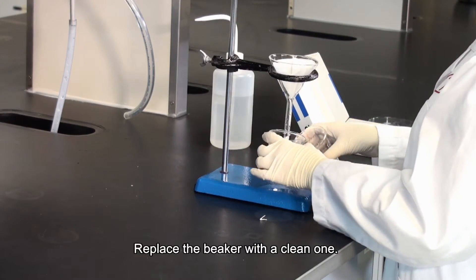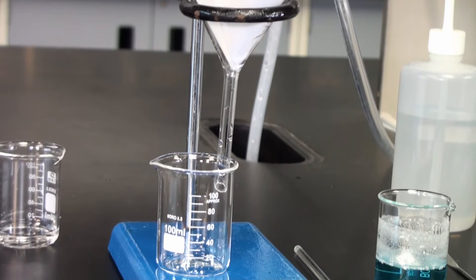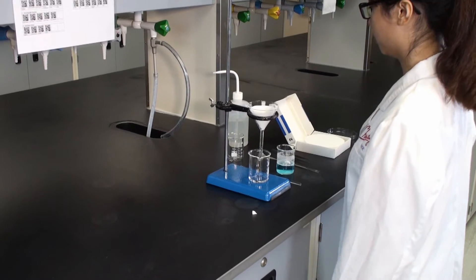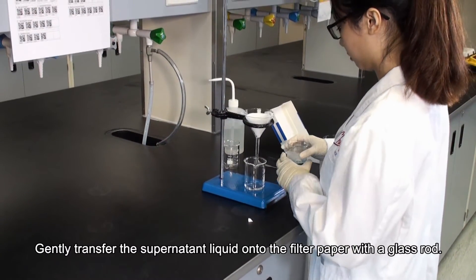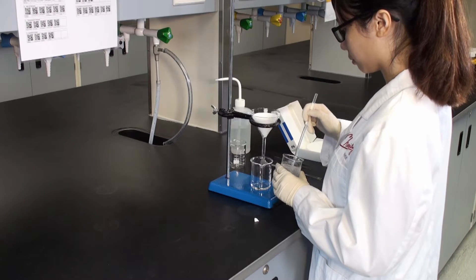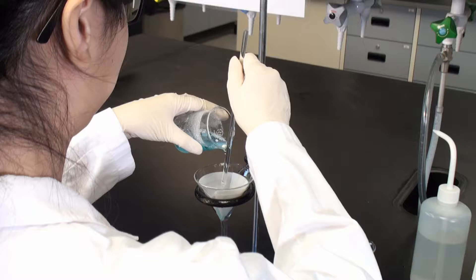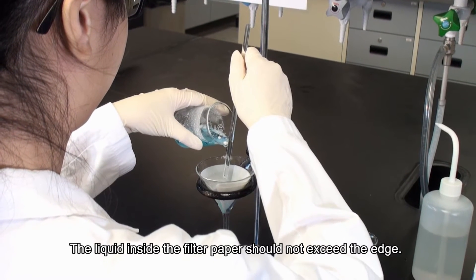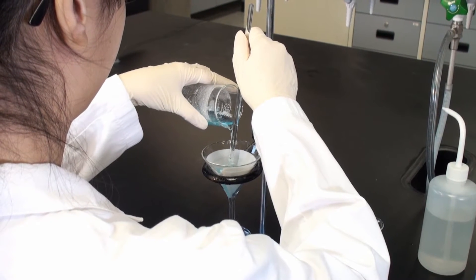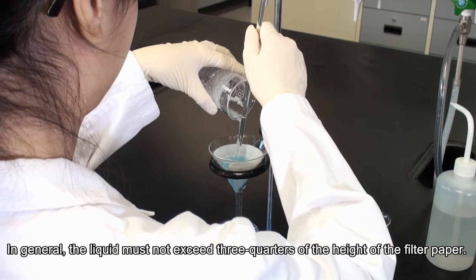Replace the beaker with a clean one. Gently transfer the supernatant liquid onto the filter paper with a glass rod. The liquid inside the filter paper should not exceed the edge. In general, the liquid must not exceed three quarters of the height of the filter paper.